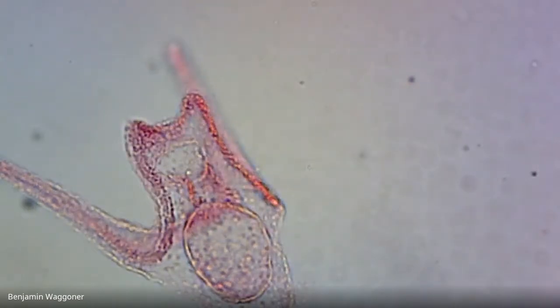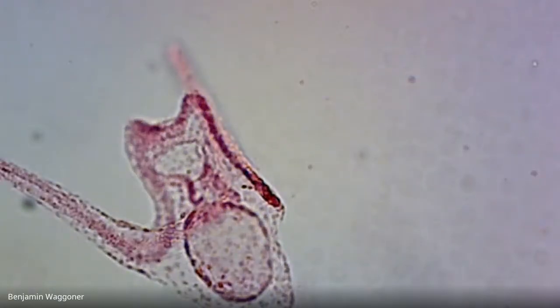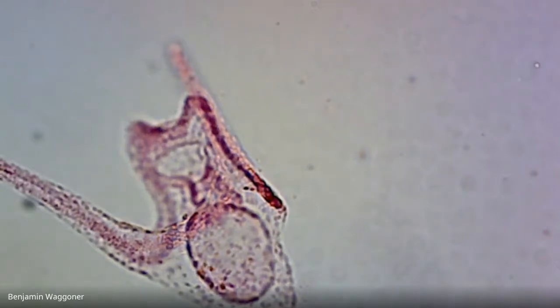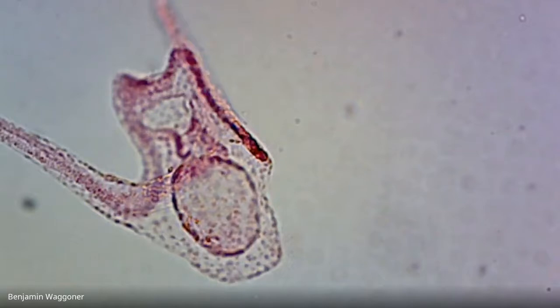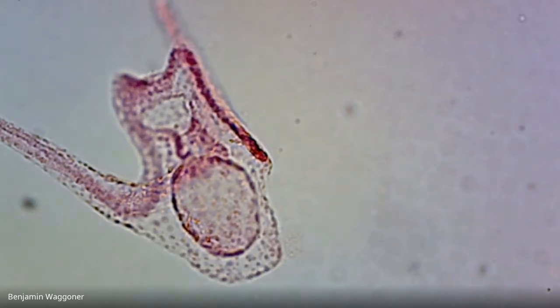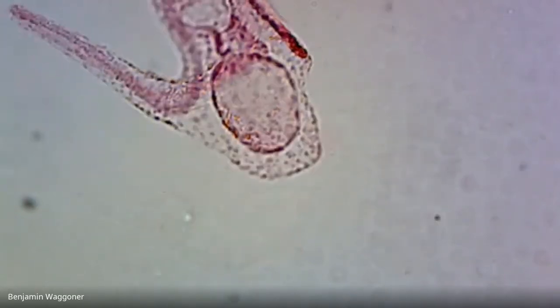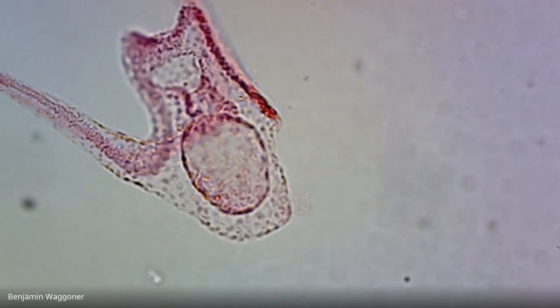Those darker colored nuclei that you're seeing are ciliary bands. That's where the cilia are that enable this thing to swim. The arms are actually supported by very fine internal skeletal rods. And the round thing right there in the middle is the gut. The mouth is up at about your 1 o'clock, and down below it, at the base of the field of view right here, right there in the center, that's the remainder of the gut. So we've got a complete gut here.